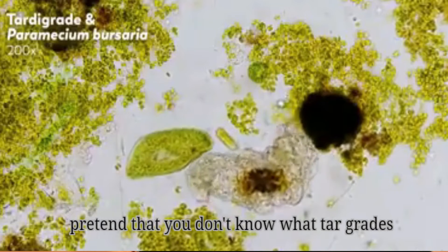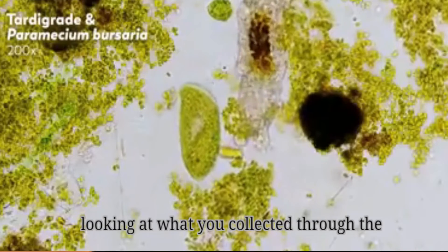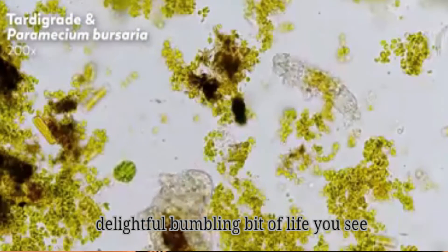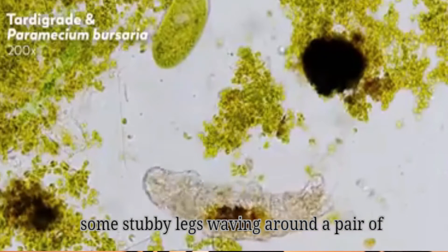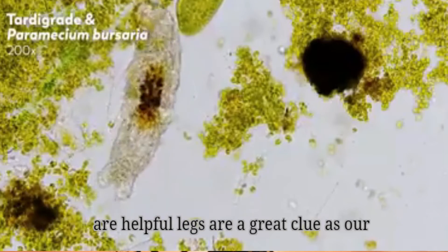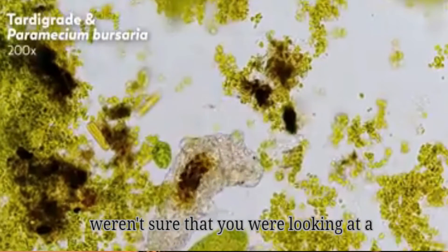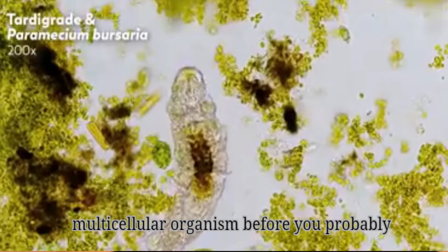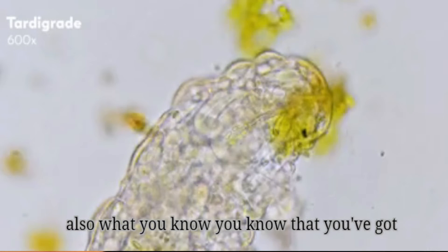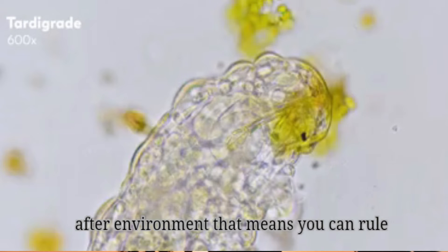Pretend that you don't know what tardigrades look like. You went down to your favorite pond, gathered some water, and now you're looking at what you collected through the microscope. On the other side is this delightful bumbling bit of life. You see some stubby legs waving around, a pair of eyes, and maybe some strange things moving around inside its body. All those details are helpful — legs are a great clue, as are eyes, and the moving things inside seem a bit like organs. If you weren't sure that you were looking at a multicellular organism before, you probably are now.